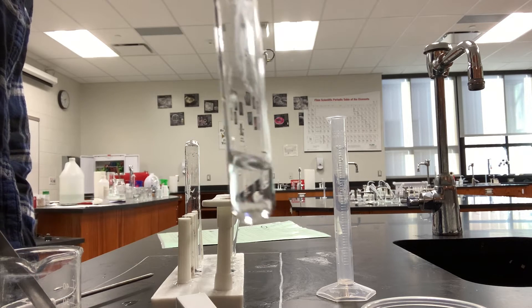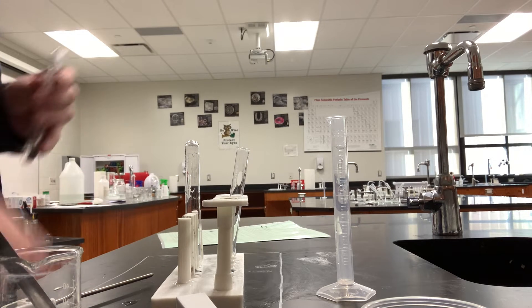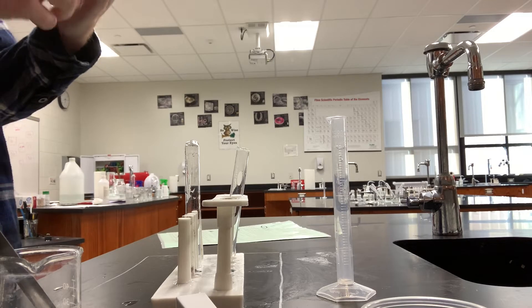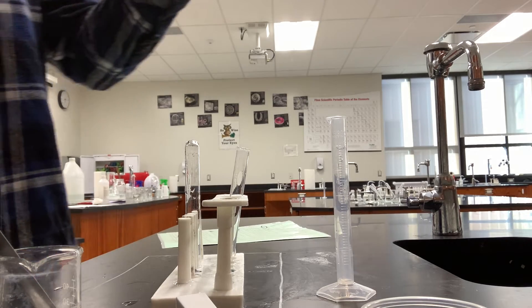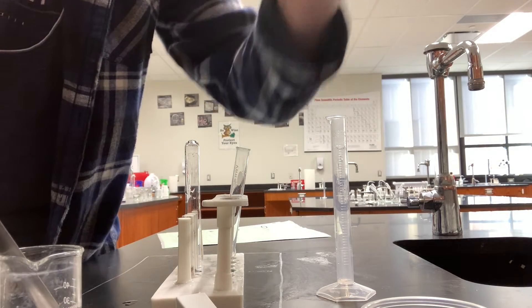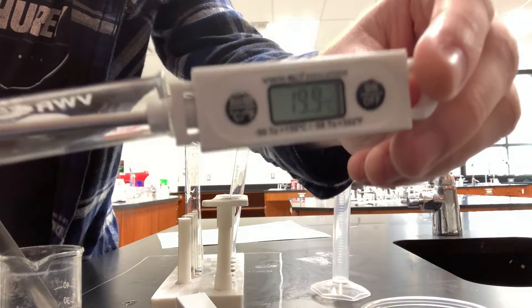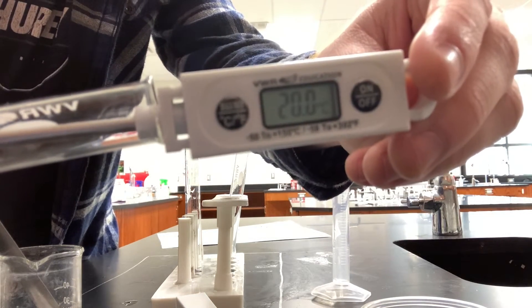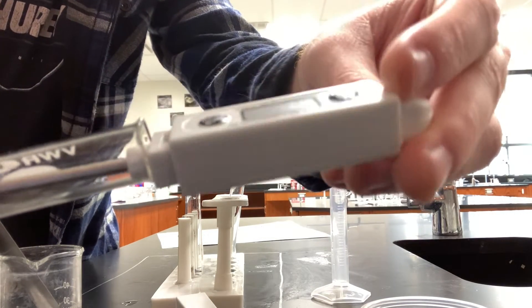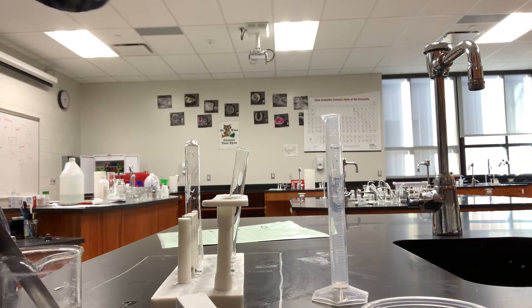We're just going to check the temperature of that right now. So it's about 20, 20-ish degrees.